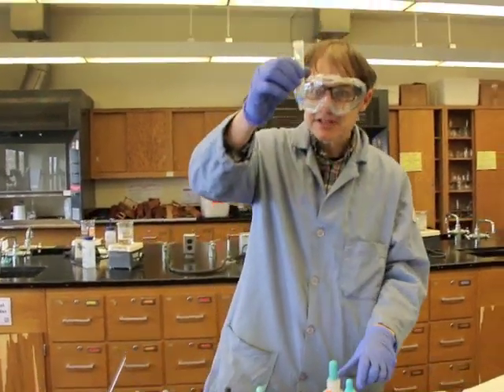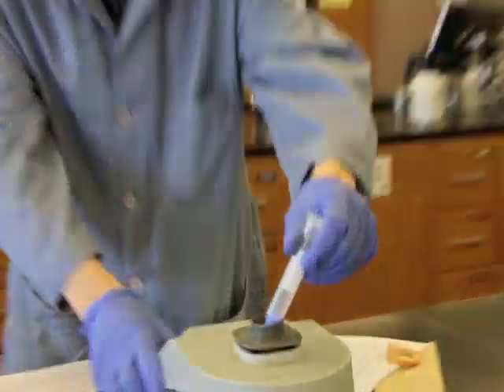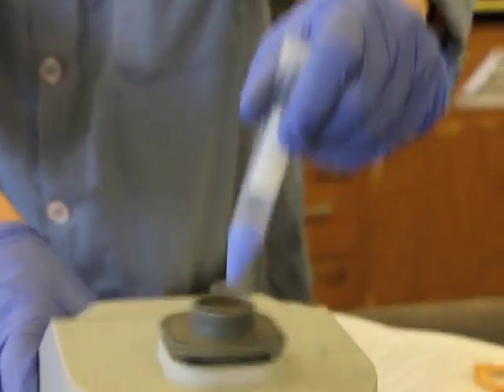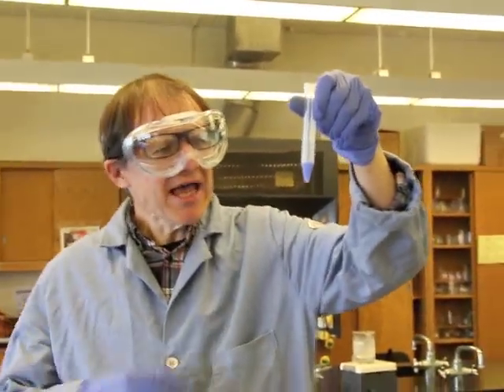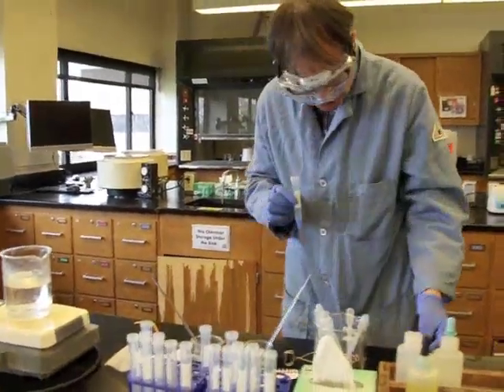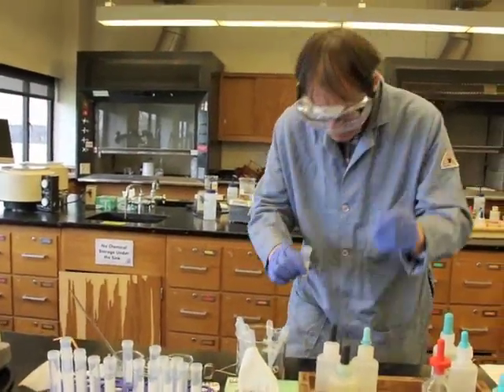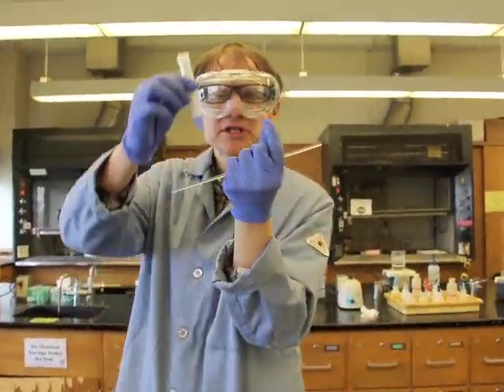Notice definitely something happened. I'll bring it over to the vortex mixer. Let's mix this solution up. There we go. That looks pretty good. We got a mixed up solution. But again, I added a base, so this should now be basic. So let's test using the pH paper to determine whether I added enough in order to make this solution basic. So I'm going to take a drop, mix it over here, take a look at what happened to the paper. See how it turned that dark green?